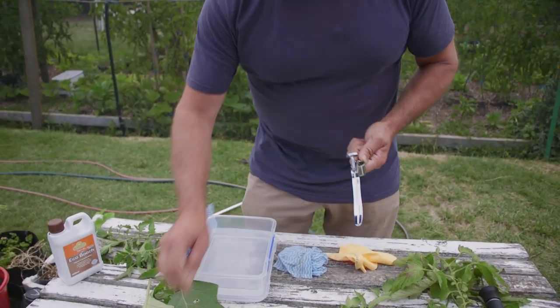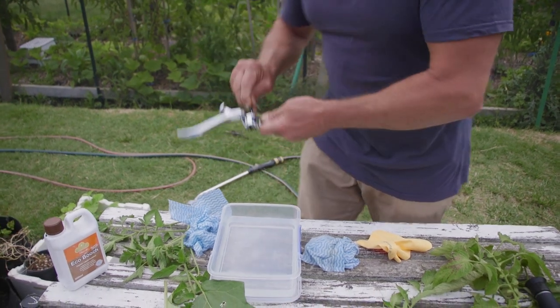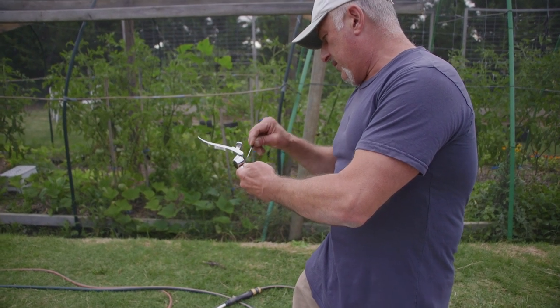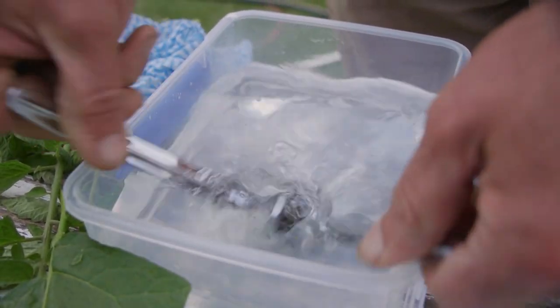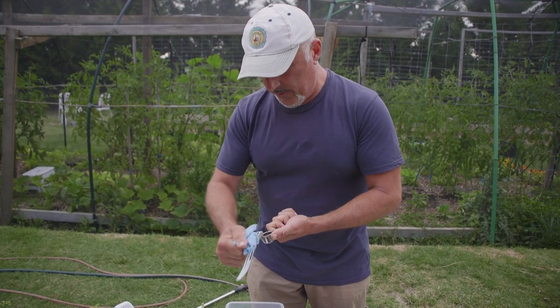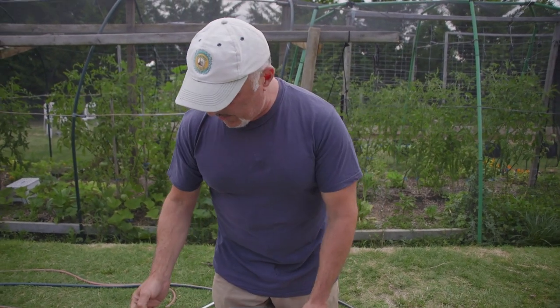So between the testing I'm going to use this little screwdriver just to get rid of the greens. It needs a little rinse so I'm just scraping this out because it's turned to muck inside. Give it a little rinse inside there, get rid of all the excess moisture, and dab it off with a fresh tea towel or something similar.